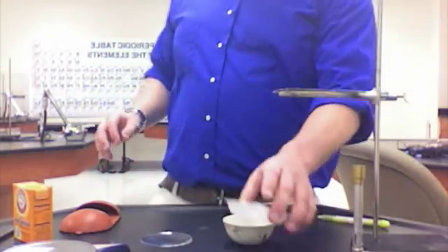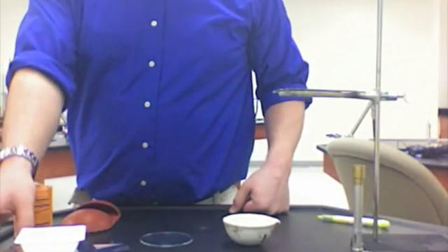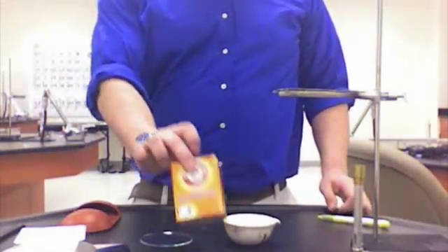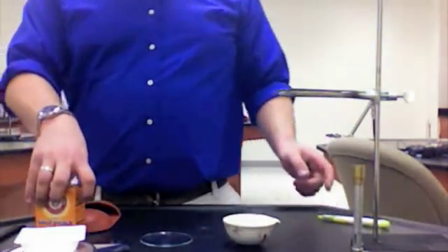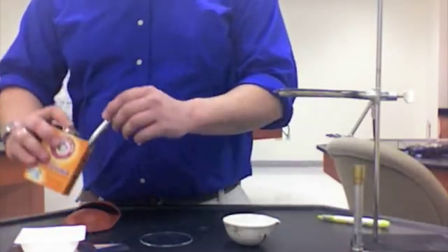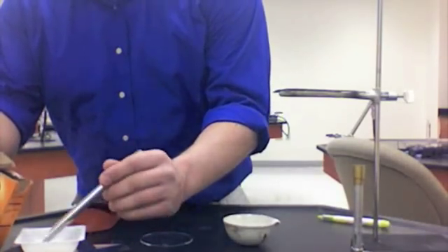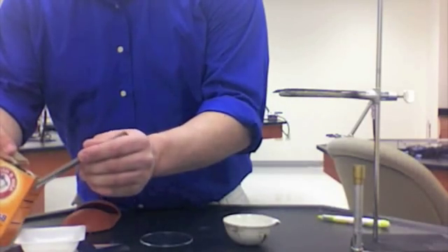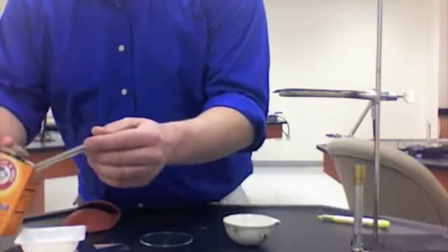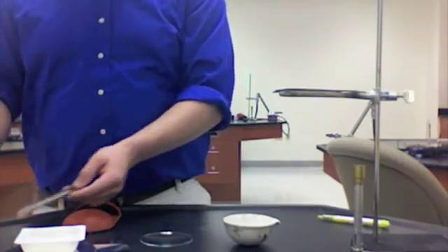Then, what we're going to do is take the weigh boat, put it on our balance and zero it out. So now that it has a mass of zero, we're going to take our sodium bicarbonate and add 2 grams in the weigh boat. We measure it out and get it right at about 2 grams of sodium bicarbonate.